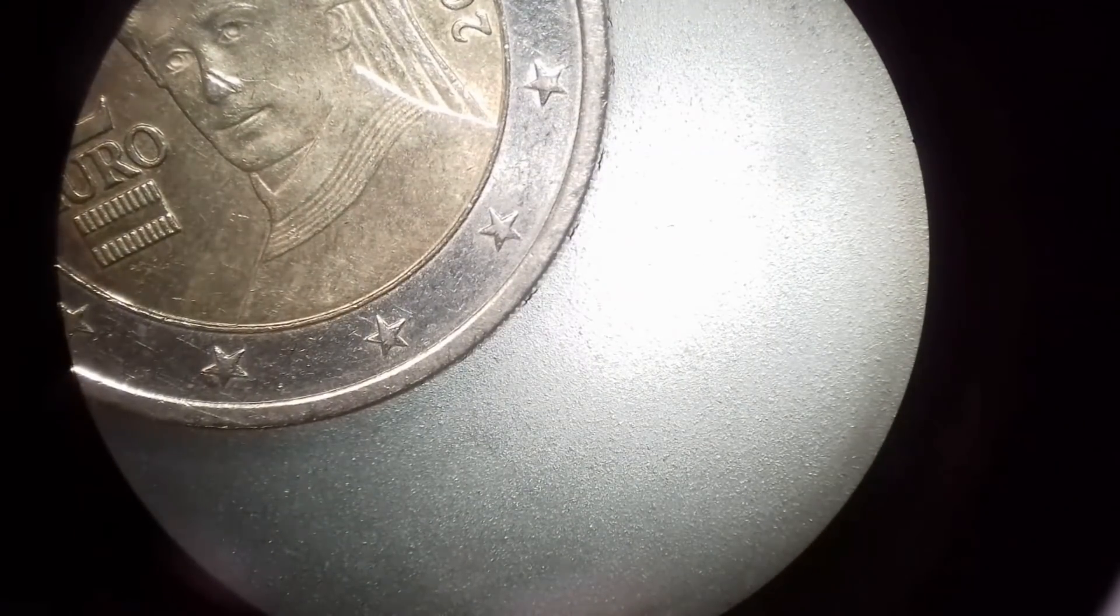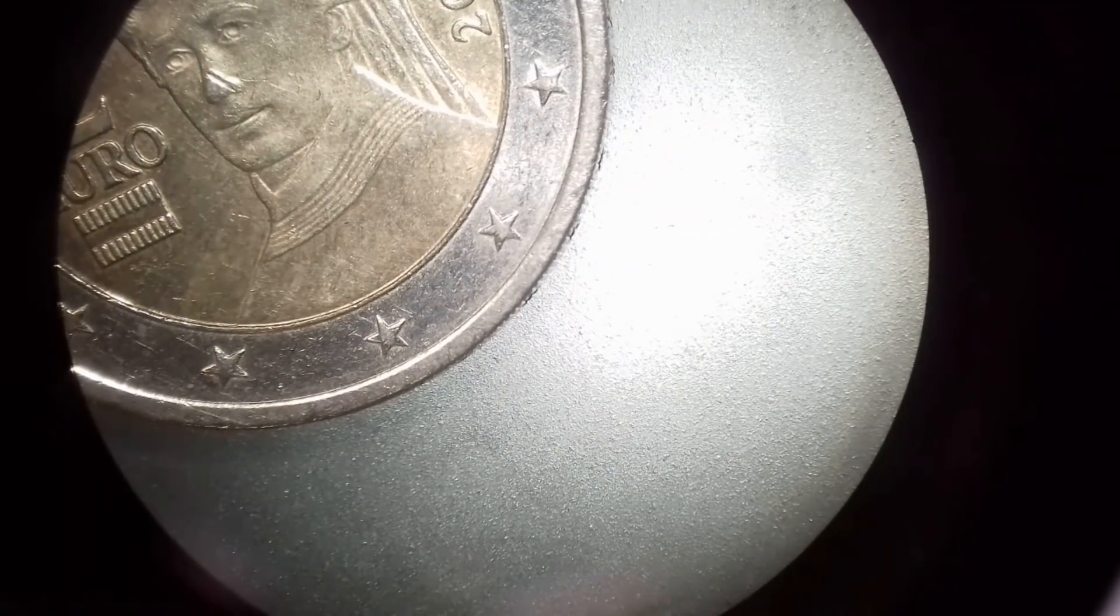Yeah, so I have to refocus right now again. And the dark shadows that you see on the lower left side and on the bottom, it's because I did not hold the camera at the correct distance. So it's simply a technical thing that I've not done quite right. Yeah, so I'm focusing right now. You can see the edge of the coin. And the camera also tries to adjust the focus. And I'm zooming out again, so that's one of the nice things that adds a lot to the visual impression, the ability to focus.